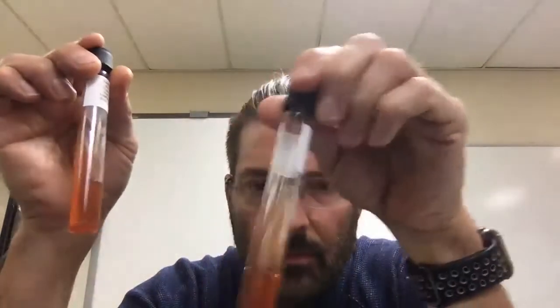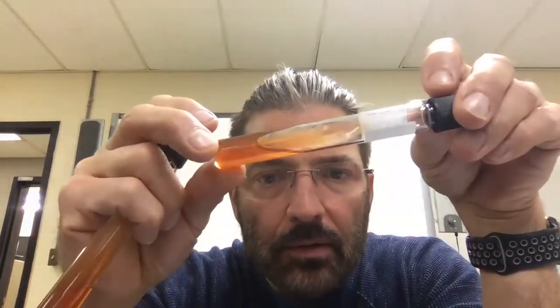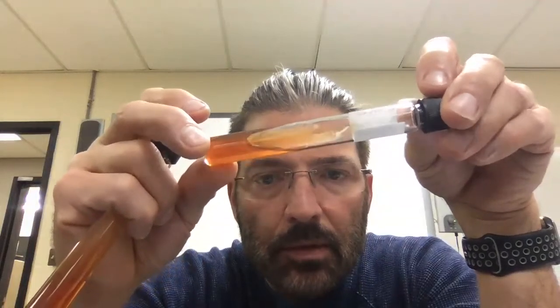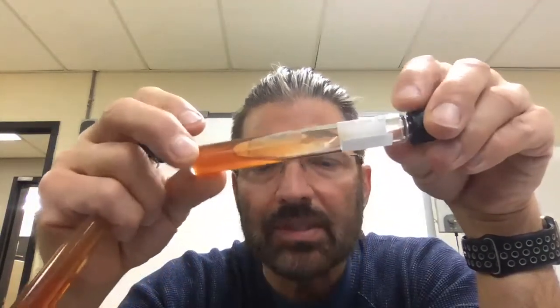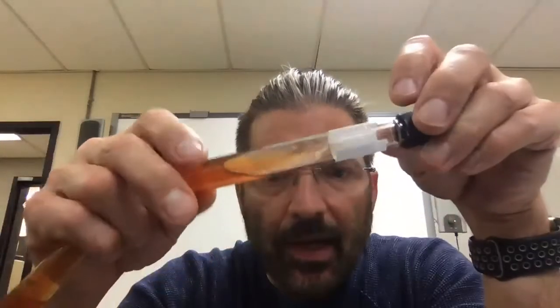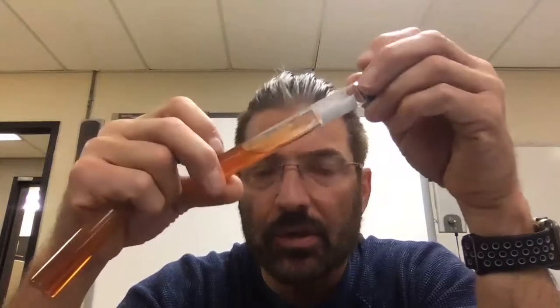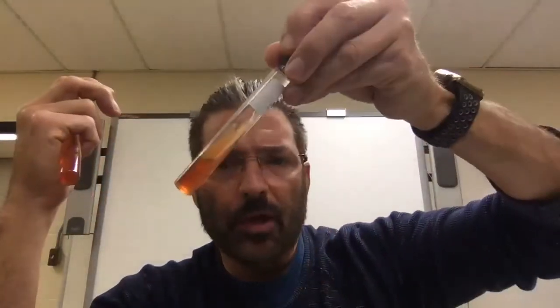Baseline, this is Pseudomonas. If you look, there's some growth on there. It didn't consume a whole lot of glucose because it didn't change the color. But if you look at that, you see all the growth on there. Now remember, Pseudomonas grows on everything. It grows on sponges, mops. It can grow on bar soap, anything. It can grow on plumbing. It grows everywhere. Ubiquitous.